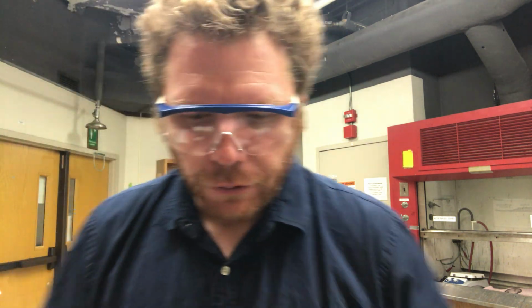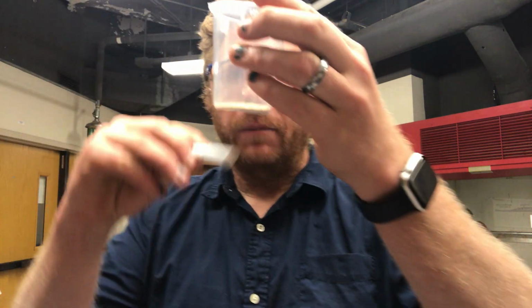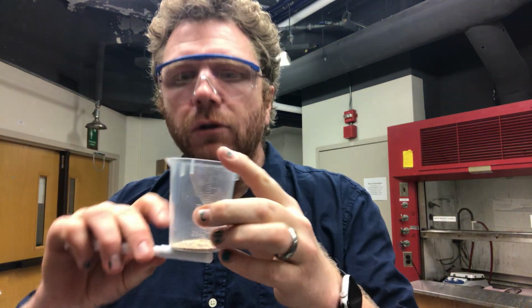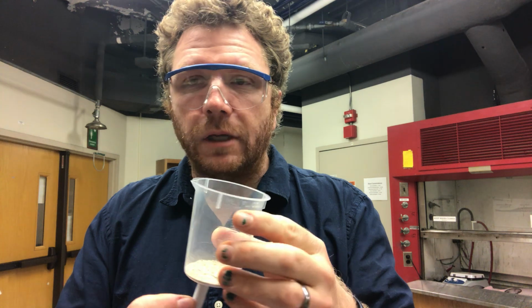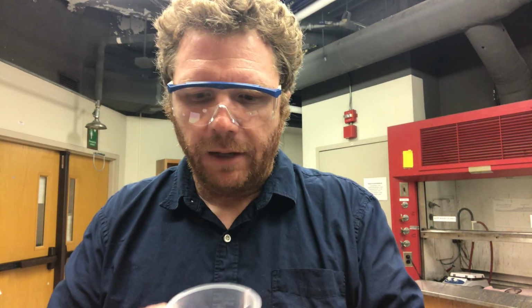Now, after that, you're told to get beaker number 1, record the exact mass. Our scales go to 2 decimal places, so that will get 2 numbers beyond the decimal. Then what we're going to do is put our magnet at the bottom of this. So what this is illustrating is what's known as a physical separation. We have a magnet, we have steel beads that are attracted to this magnet.